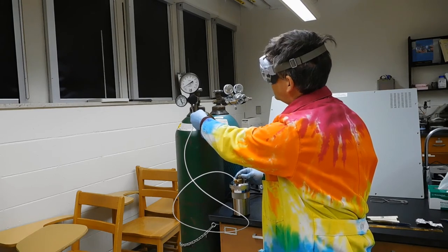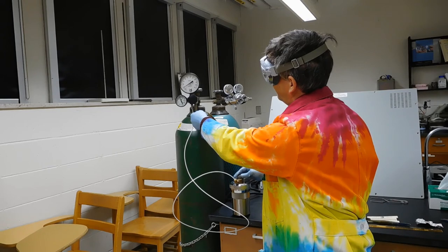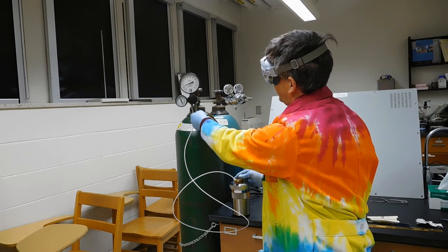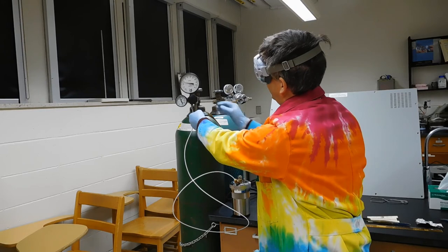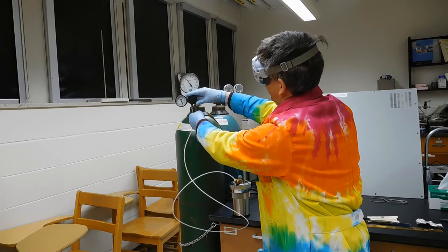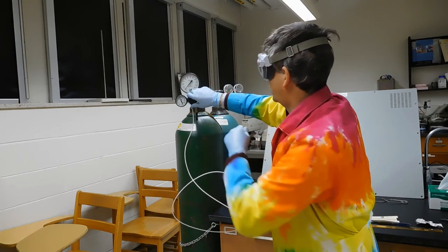So if you watch when I close this, the pressure will start to go up. You'll let it rise to about 26. When you get there, you release that, and then you shut this valve.